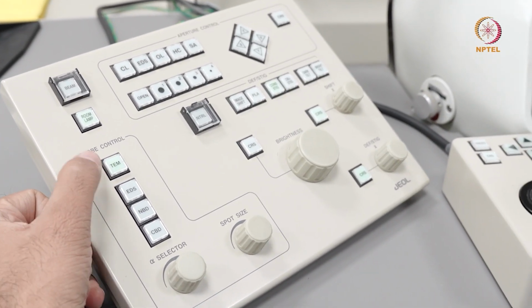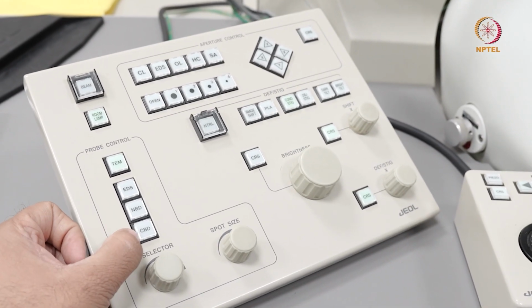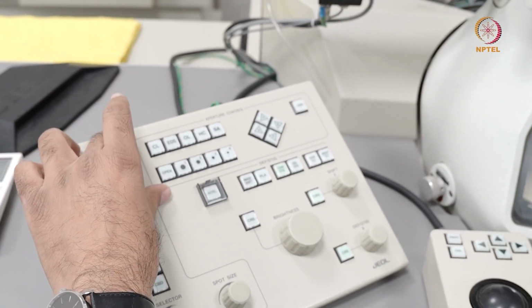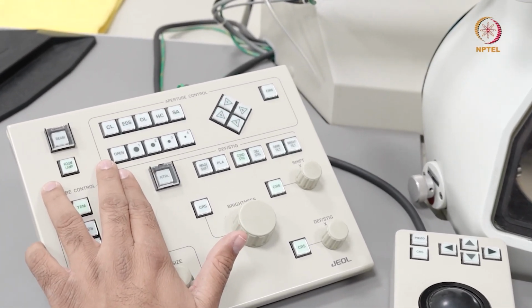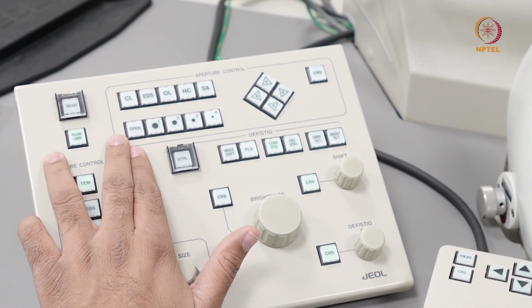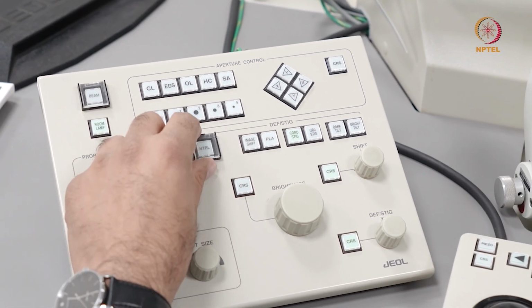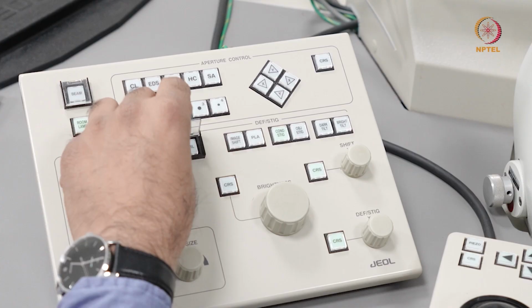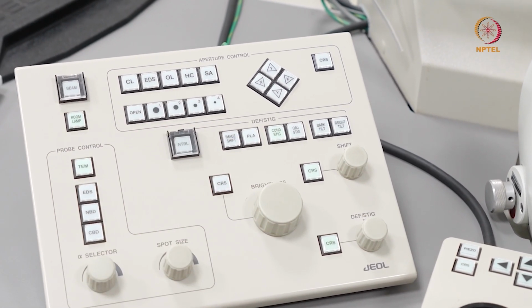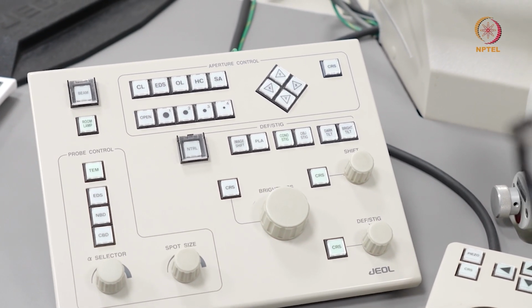So you can switch between the TEM mode, the EDS mode, the nano beam diffraction mode, or if you're doing convergent beam electron diffraction. There is aperture control here. On this particular microscope, we do not have motorized apertures. But if you have motorized apertures, you can in principle control the apertures by selecting these. Now, what you have here is a sort of a normalized thing. If I press this neutral, it runs through a loop and resets all the currents of all the lenses and all the deflector coils to the default value, which is close to the alignment value.